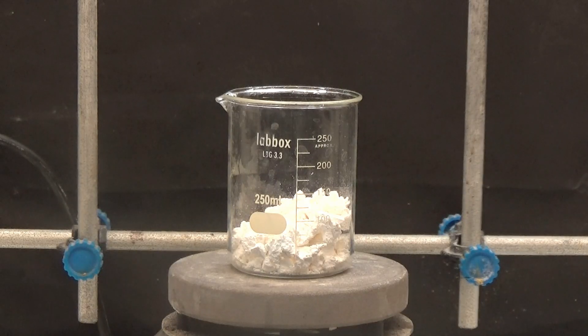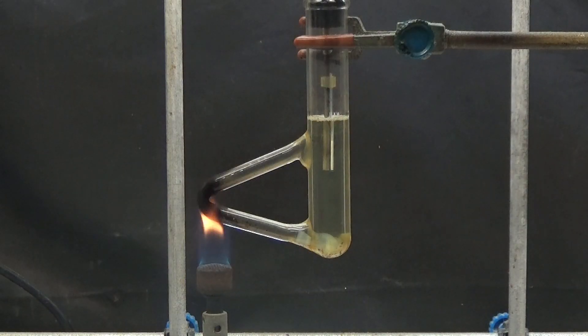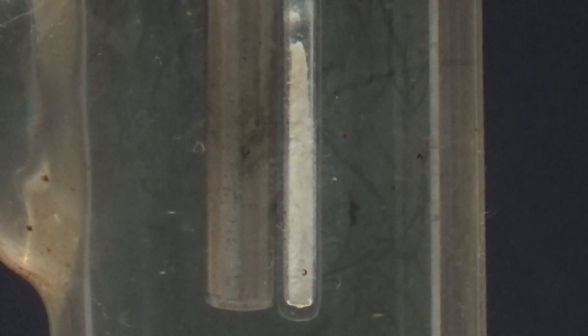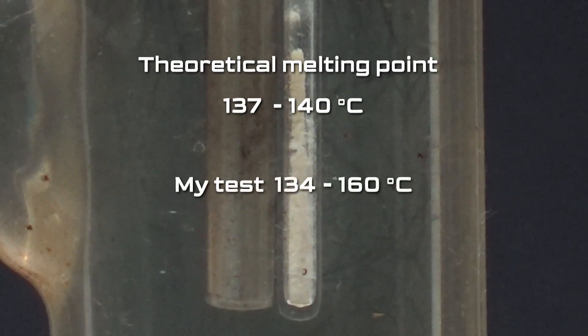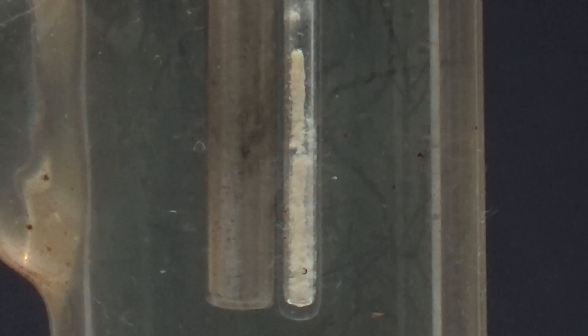After drying the acid in an oven at 60 degrees, six grams of orthochlorobenzoic acid have been obtained. To determine its purity we test the melting point. The theoretical melting point of the acid is 137 to 140 degrees and in my test I obtained the value of 134 to 160 degrees. The melting point shows that the product is impure.